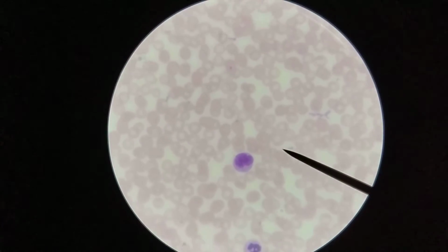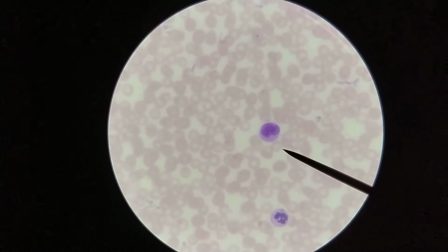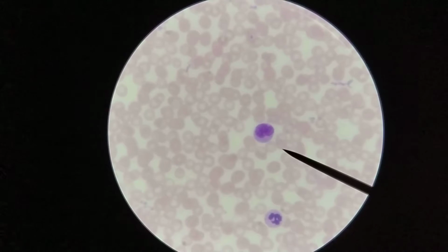Here we can see very clearly again a very large, fairly pale staining nucleus in comparison to the others. This is a cell that has to be able to differentiate into several other different cell types, and so it has a lot more active genes, a lot more euchromatin available, and so it's going to have much more decondensed chromatin, and so a larger nucleus and more poorly staining.